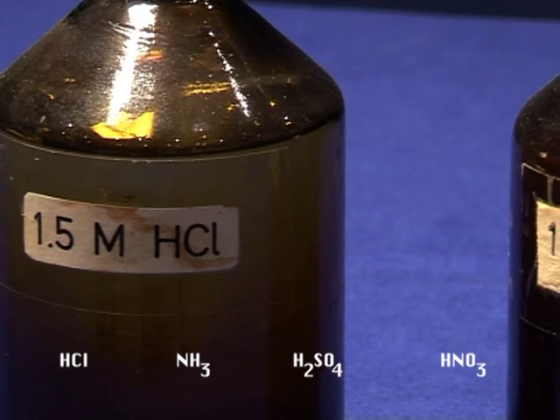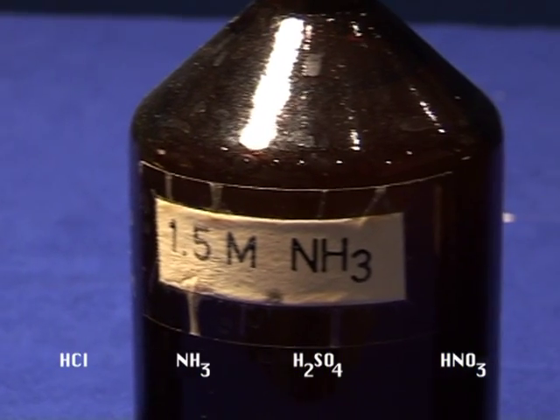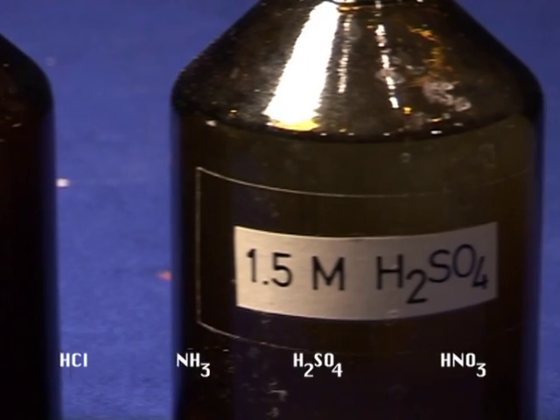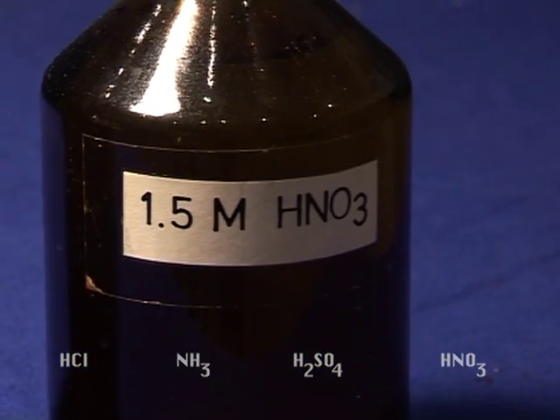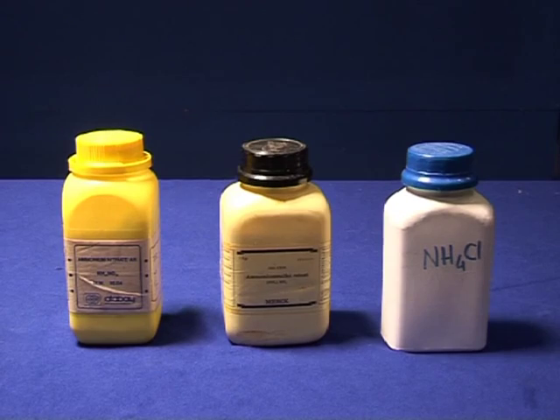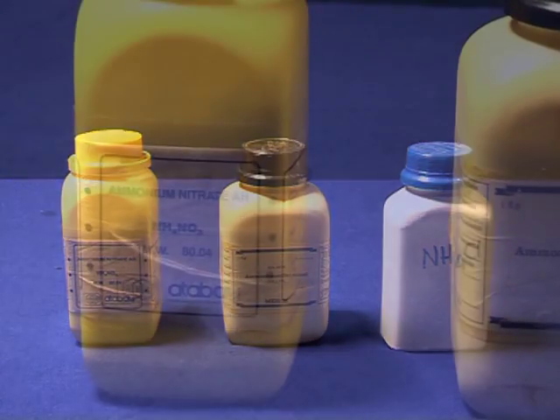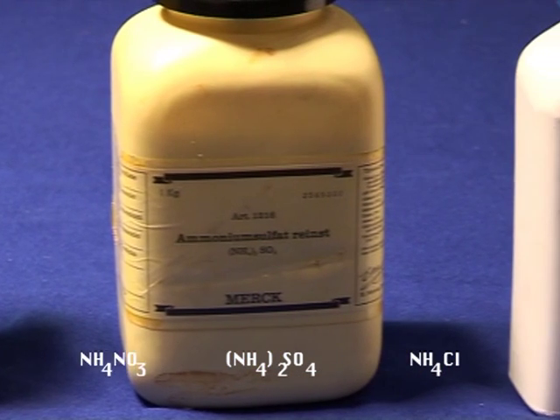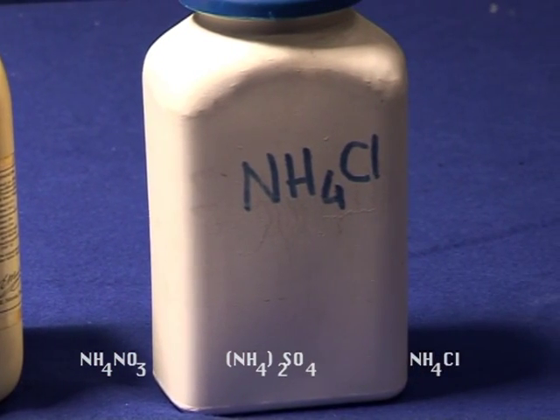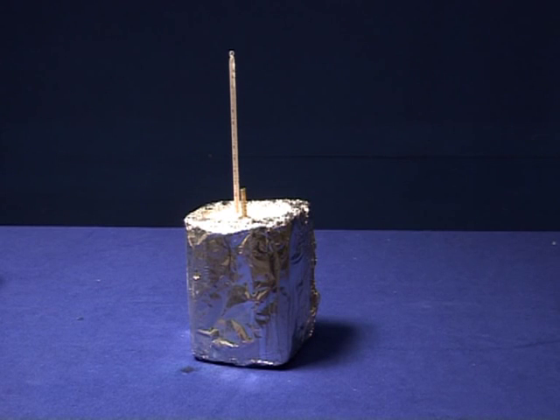Hydrochloric acid, ammonia, sulfuric acid, nitric acid, ammonium nitrate, ammonium sulfate, ammonium chloride, insulated cup and thermometer.